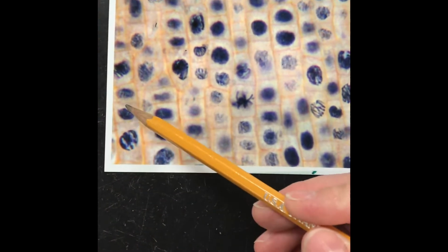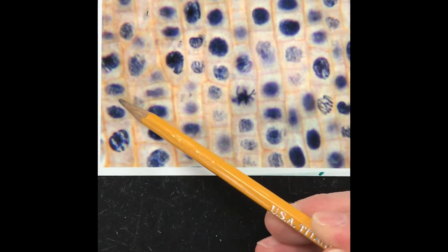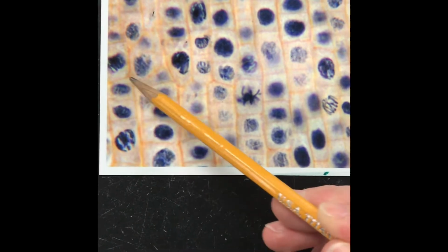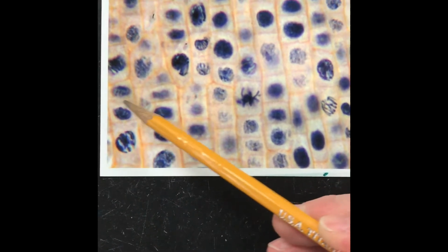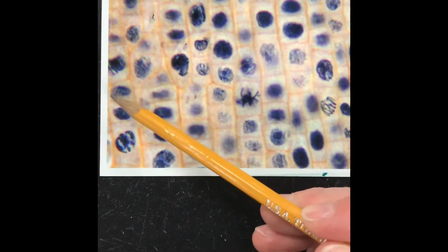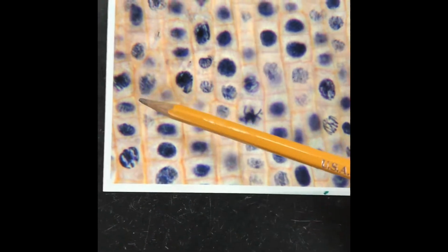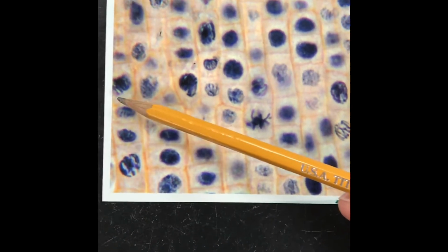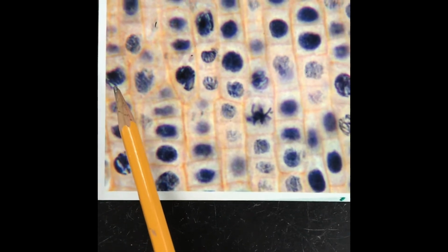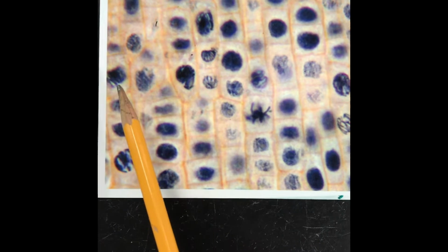If you look above that, can you guys see that this is a nice little cell plate right here? This is 1 plant cell, what I'm outlining with my pencil, and it is in telophase and cytokinesis. So that means this one's in prophase, this one's in telophase cytokinesis, so that's 2 so far that are in M. All right, look at the one above it. You see this one? I also consider this prophase because I can see the coiling and condensing right there where you see my pencil is. Okay, so that's a 3rd one for M.